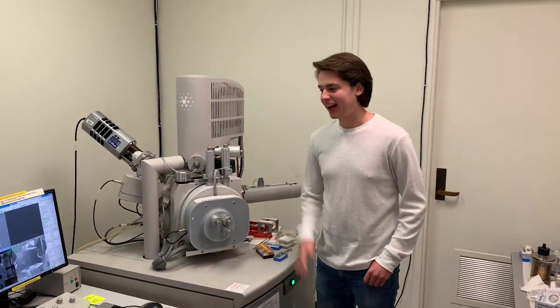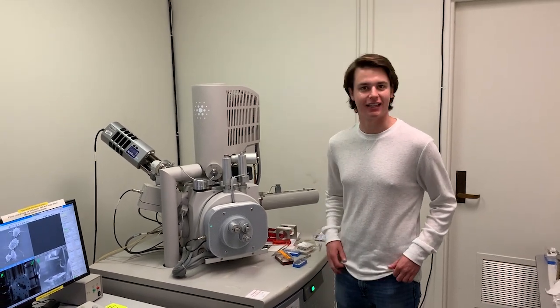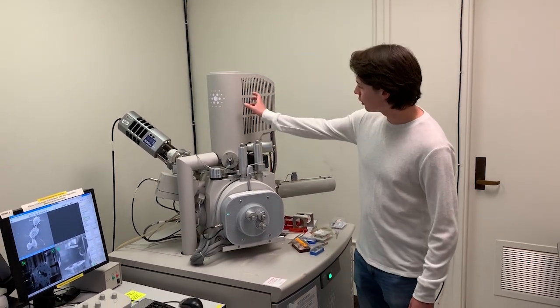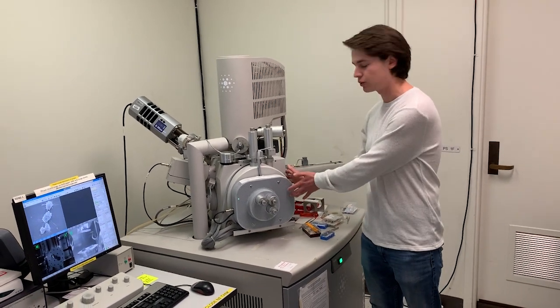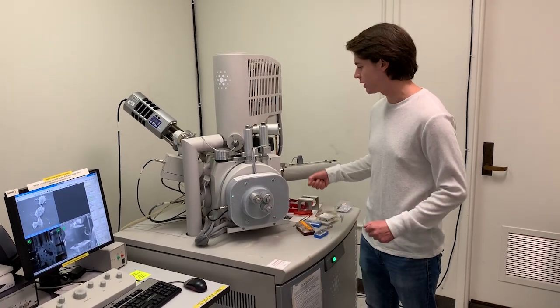Hi, I'm Spencer. Again, as Ingrid said, I work here as the TA for the SEM class, and I'm going to be showing you basically how it's used and showing the cells on it. So here we have the SEM. Right here we have the column where the beam of electrons comes from, and in here is the actual chamber. Typically when we load a sample, you'd have to vent it, and then this would slide open, and you could load your samples.